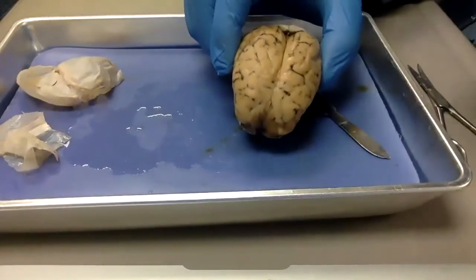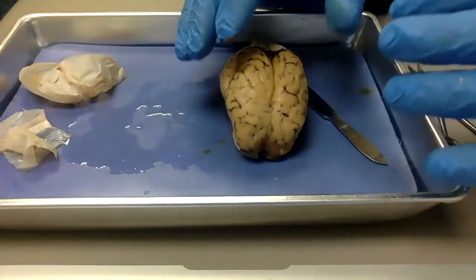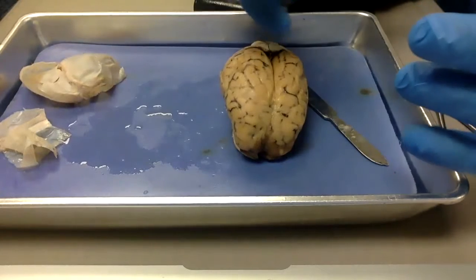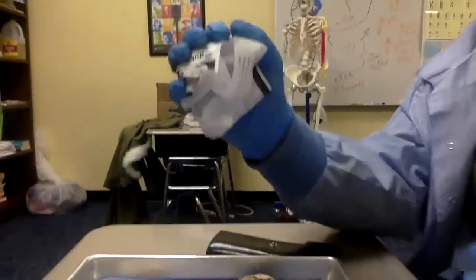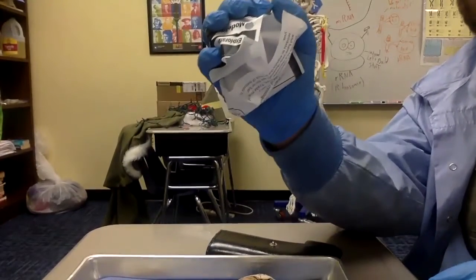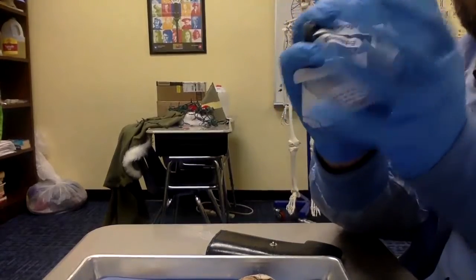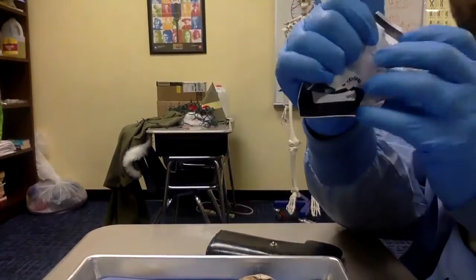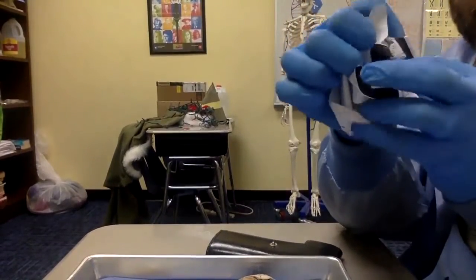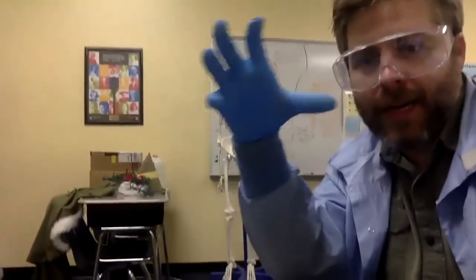So remember, the reason we have those wrinkles in our brain is because as your brain grows, you run out of room. It's inside of a skull. So in order for your brain to get bigger, it needs to cave in on itself. Take this paper ball, for instance. If I wanted to add mass to this paper, because it's a brain and it's getting smarter, but it can't get any bigger because it's trapped inside the skull, I'm going to have to bend it inward instead of outward. It's going to get denser and much more wrinkled. And that's what happens to your brain. As your brain gets bigger, it's going to fold in on itself and get more wrinkled.